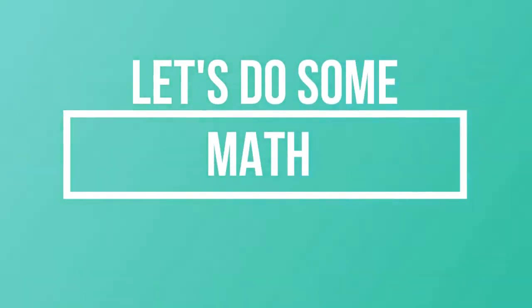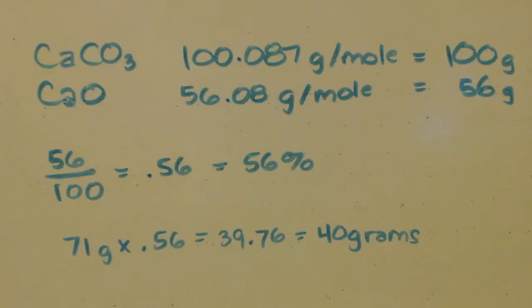You can see there's no water on the test tube. If there was water on the test tube, you'd see little droplets. That would mean that this was not all calcium carbonate, and some of it is calcium hydroxide. And as you can see, there's no... well, let's do the math.